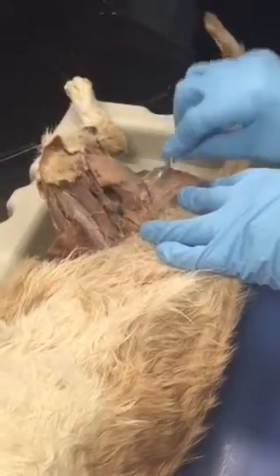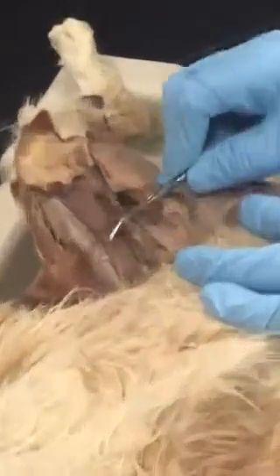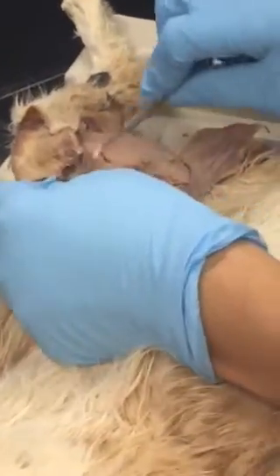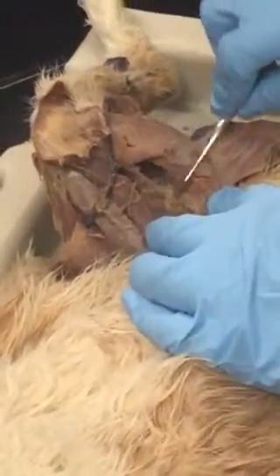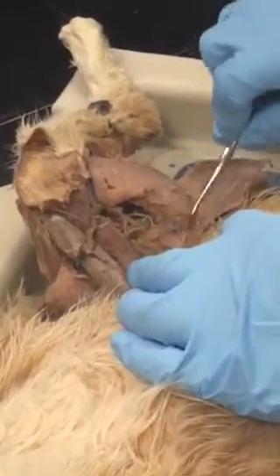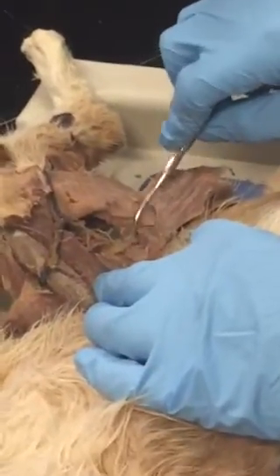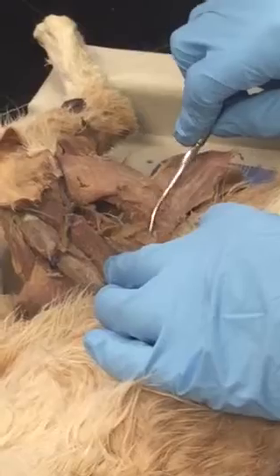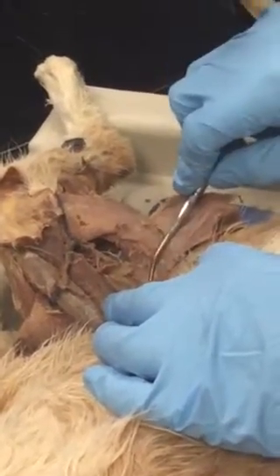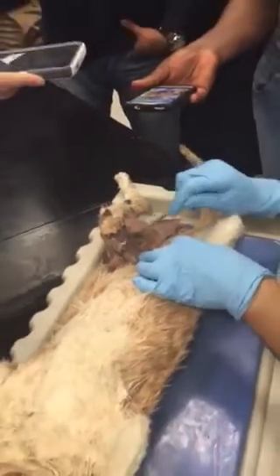The student told me that on the practical, your lab manual didn't label it. By the way, I'm cleaning away blood vessels and this nerve. I was told that your lab manual doesn't label which adductor muscle. If that is the case and I test you on this, I just accept adductor muscle. If you say adductor longus, I take it. If it's adductor magnus, I take it.